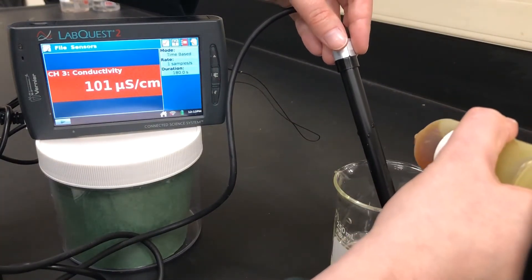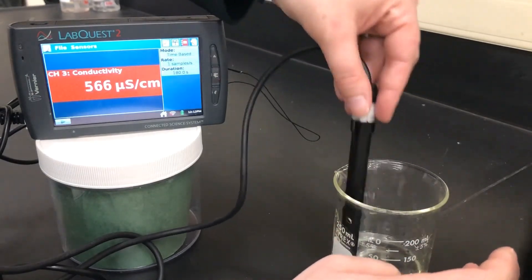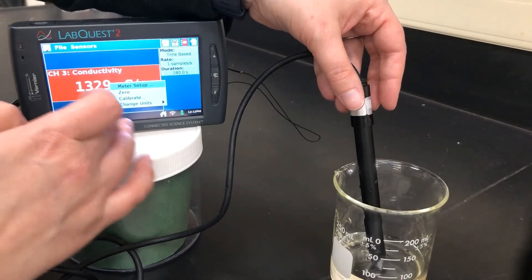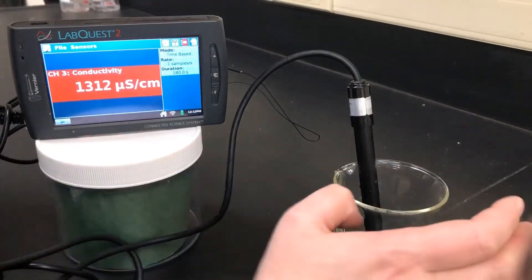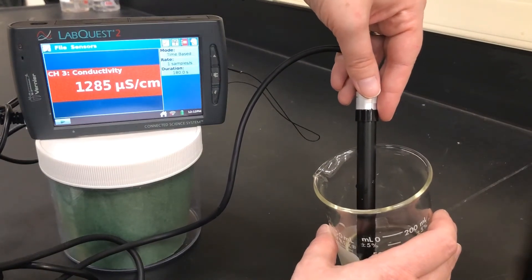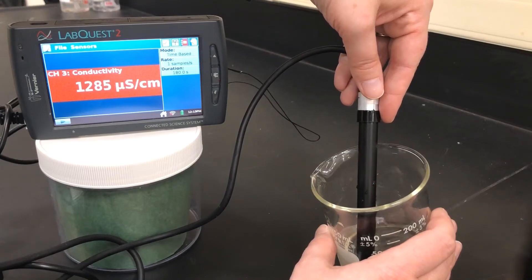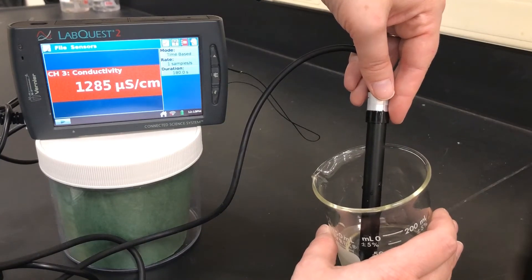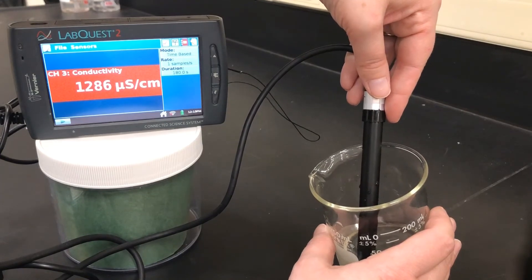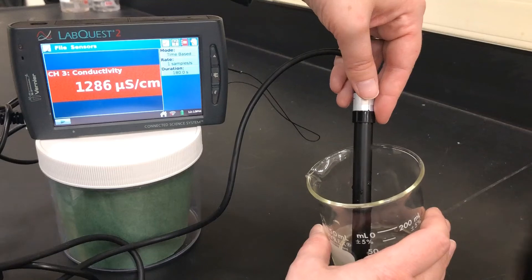Now let's do our third and final drop of iron 3 chloride. We're going to record the conductivity so we can compare the three solutions. 1286 is our conductivity for the third drop of iron 3 chloride.